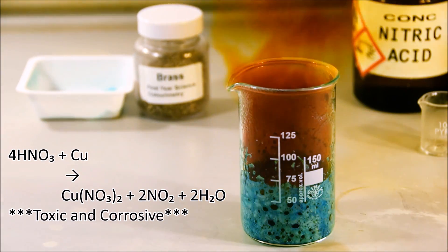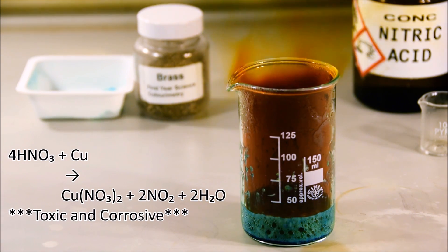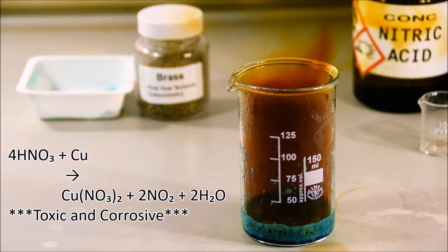As you can see from the reaction on the left, nitric acid plus copper gives you copper nitrate, which is soluble in water, nitrogen dioxide, which is a brown gas you can see, and water.